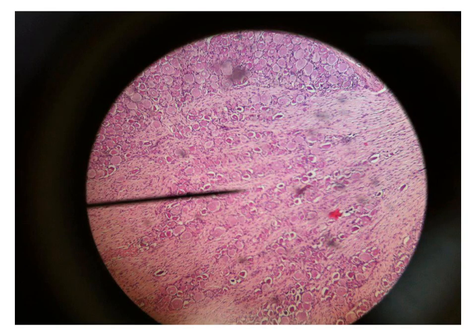We will see this ganglion under the microscope after its staining with hematoxylin and eosin. It has the same characters. It is formed of nerve cells. These cells are in groups, like this big group, or in parallel rows, separated by the nerve fibers in between. So this is the spinal ganglion.